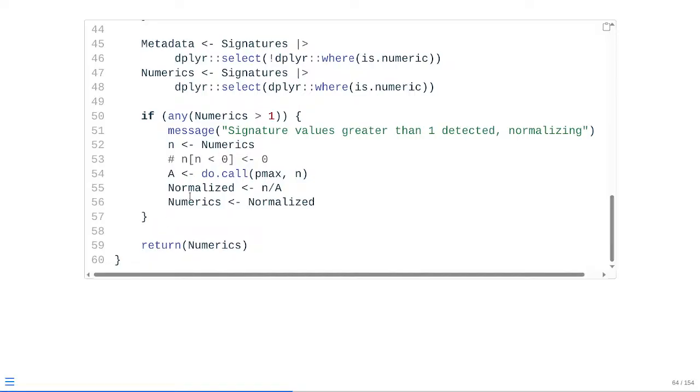And then at the end, we're just overwriting the intermediate normalized values, putting it back into the numerics name. So that way, both of these coincide back to where they need to be with a numerics value data frame that has values between 0 and 1.